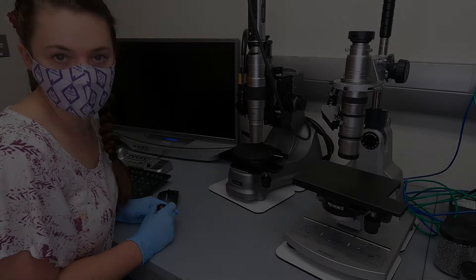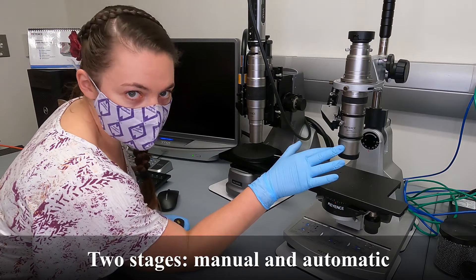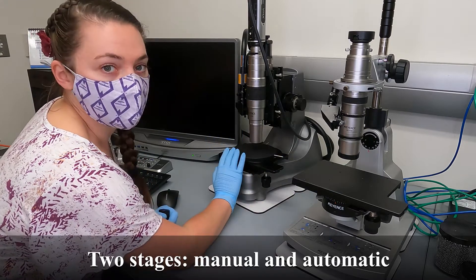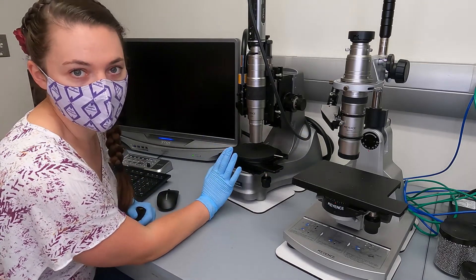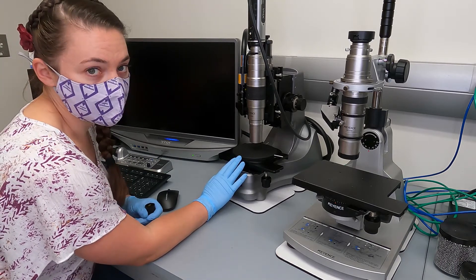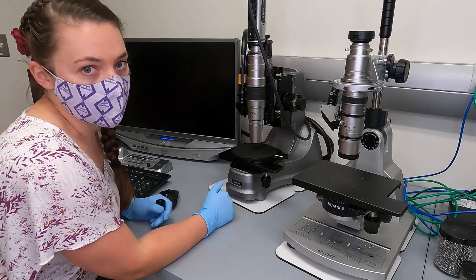Happy to help if you have any issues. We have two stages: a manual stage which holds our Z00, Z20, and Z100 lenses — not our highest mag lens, which is the Z500. The three low mag lenses can go on the manual stage, and the high mag lens, which is 500 to 5000x, needs to go on the automatic stage — automatic only meaning it can move automatically in the Z direction but not in X and Y. It's still a manual XY stage.